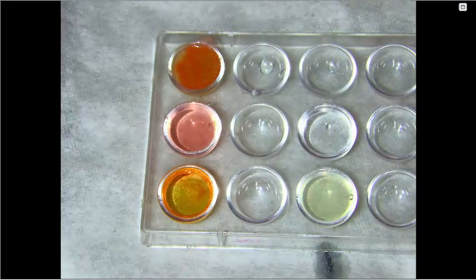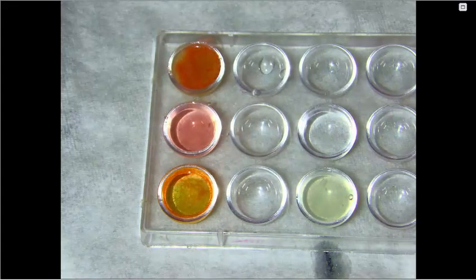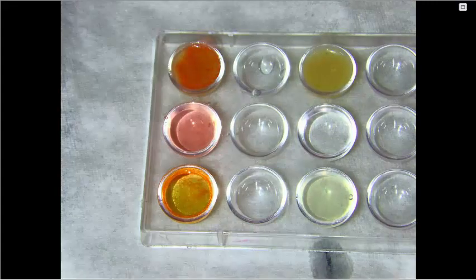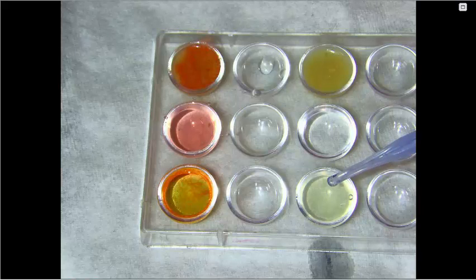And in the third one, we will put our McMush. To test for proteins, we are going to use Biuret's solution. So we'll put a few drops of Biuret solution into each. So we'll put about 10 drops.